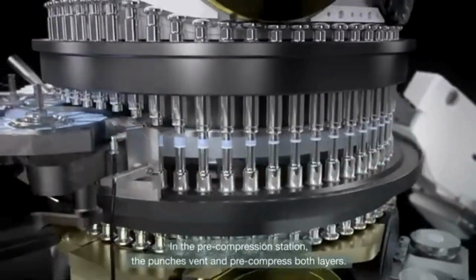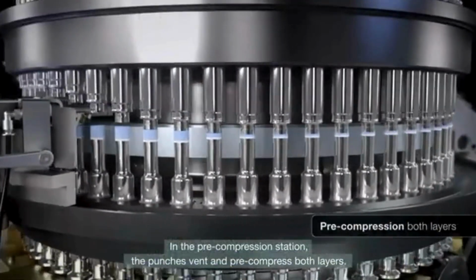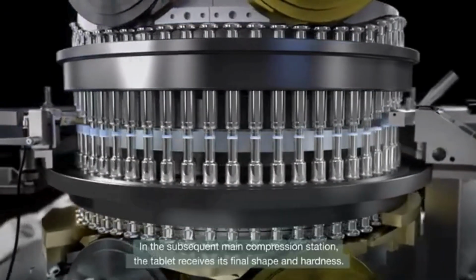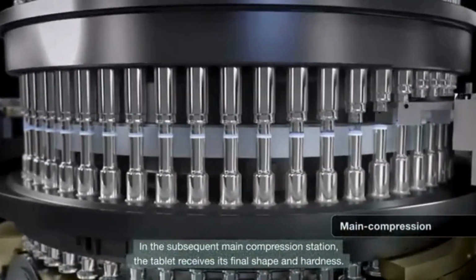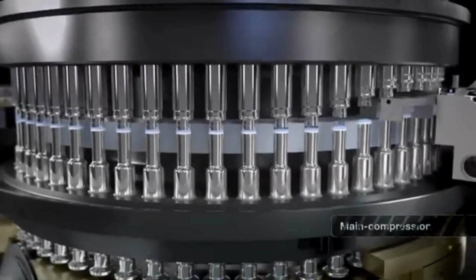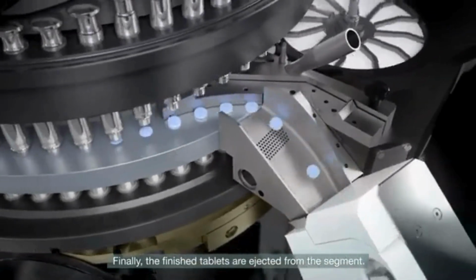In the pre-compression station, the punches vent and pre-compress both layers. Then, in the subsequent main compression station, the tablet receives its final shape and hardness. Finally, the finished tablets are ejected from the segment.